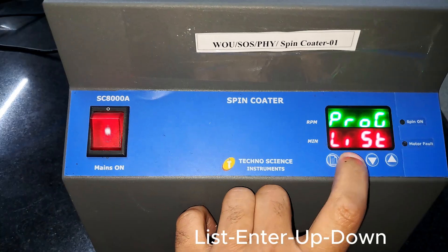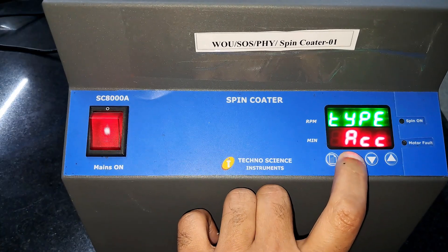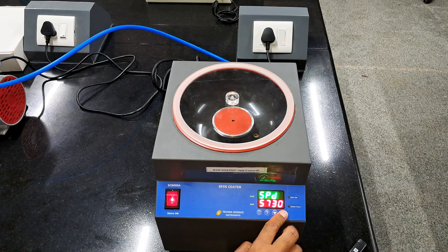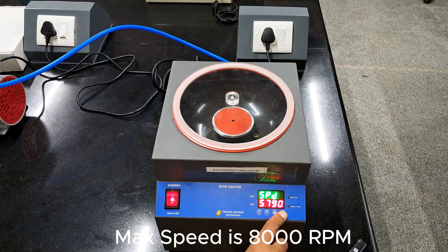It has total four switches to program and execution. At first we have this list button. Program list will appear by pressing enter.